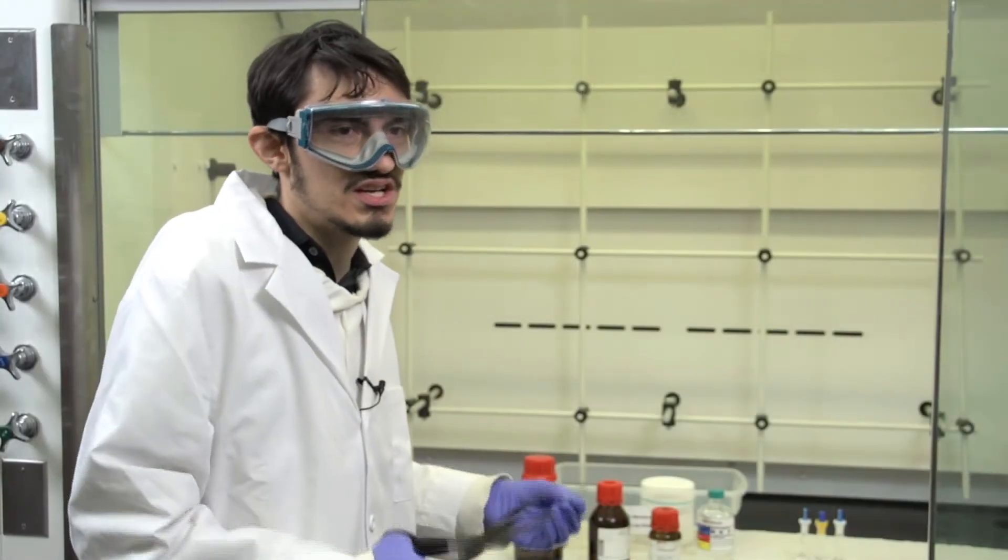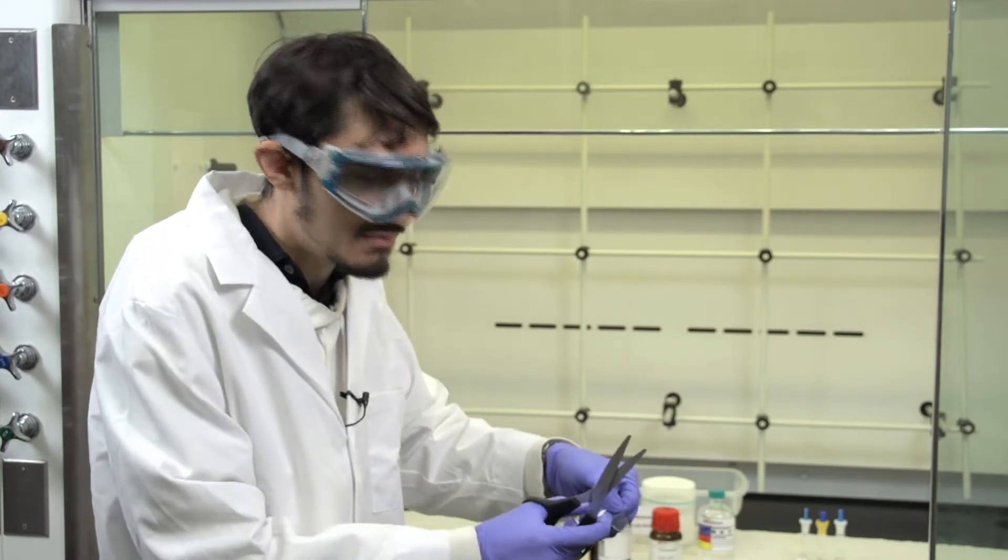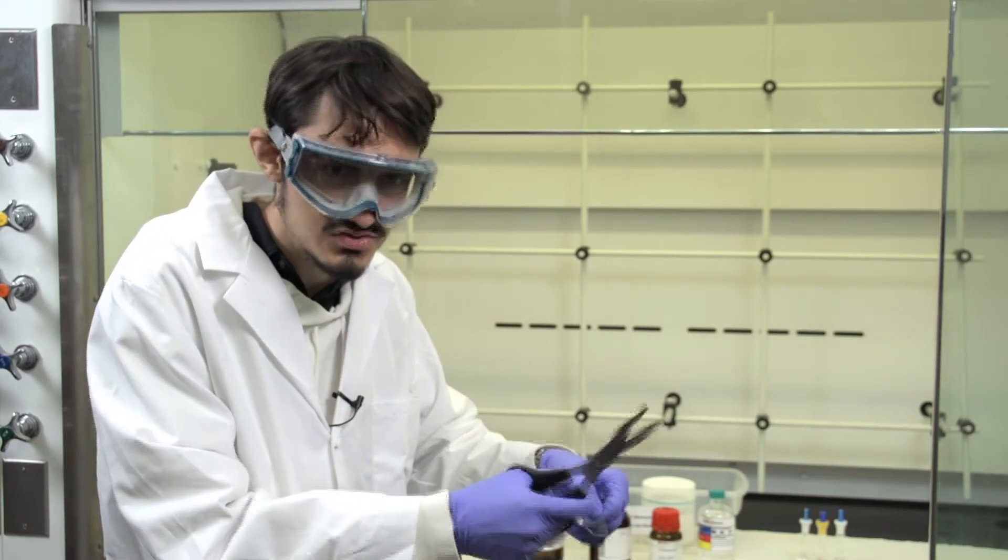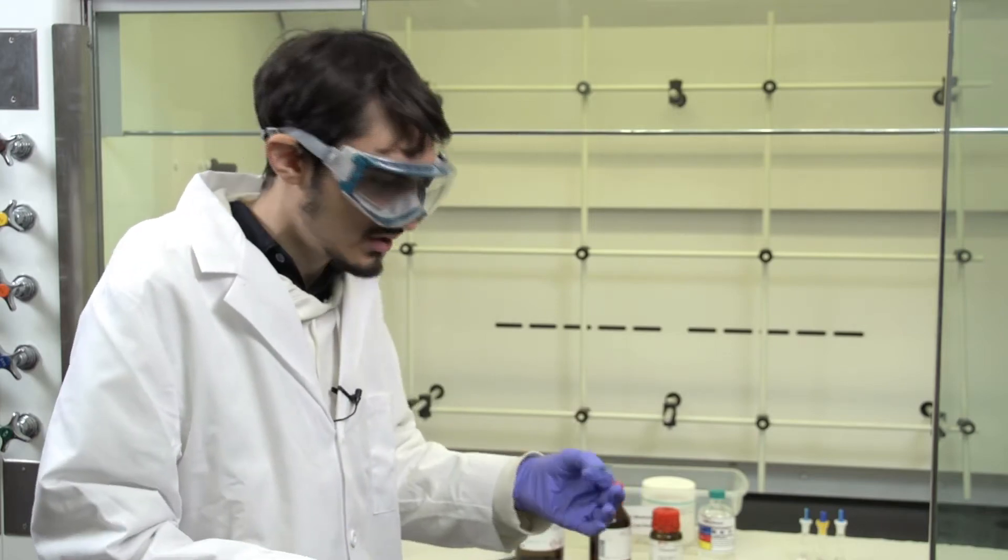Use scissors to cut out three pieces of CD, making sure that they are label side up or the place where the label used to be on the CD up, because this is the side you're going to use for the pattern.